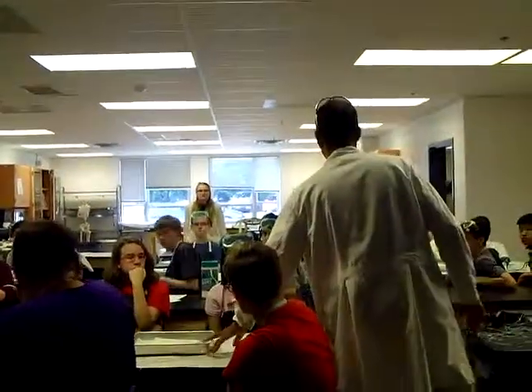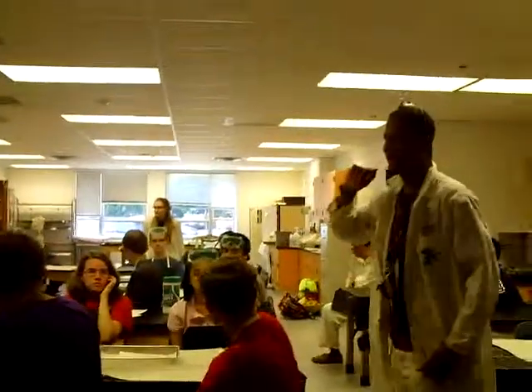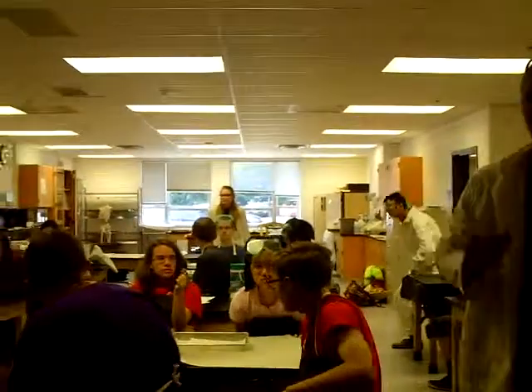Okay, let's go ahead and do this. If you don't have one of these trays, go get a dissecting kit and we'll get grouped up and then we'll start. Ready to dissect!